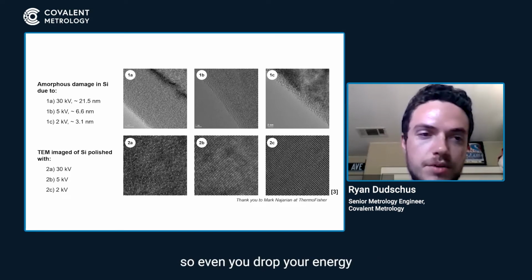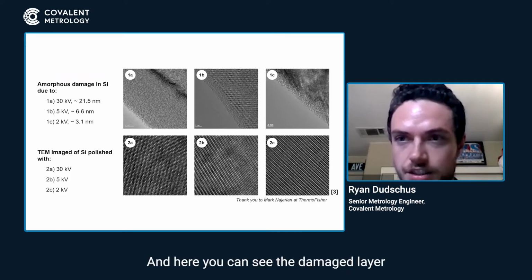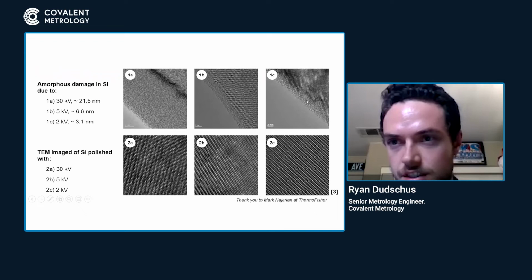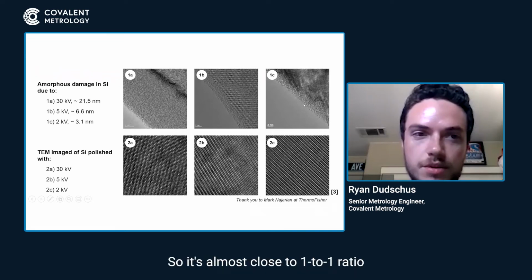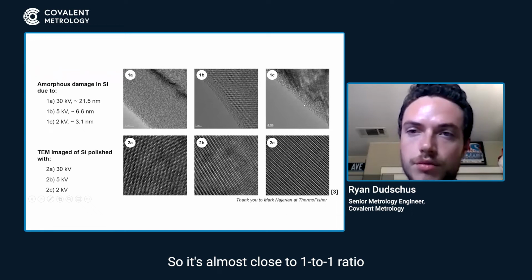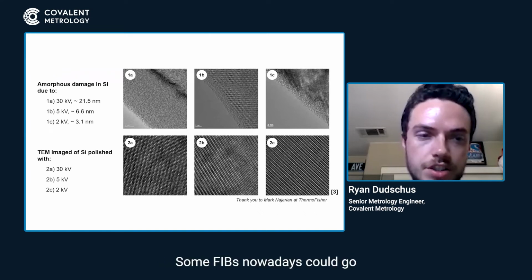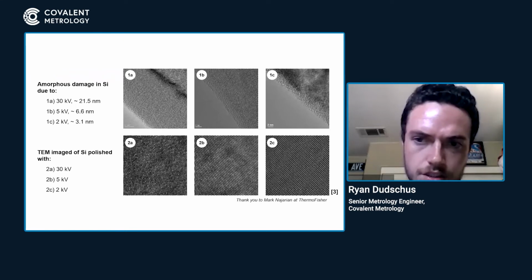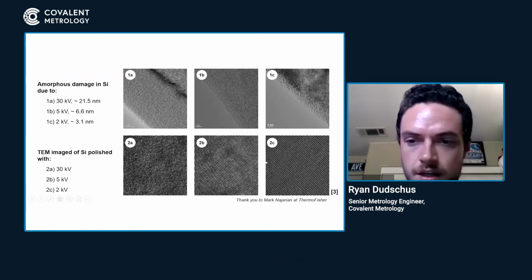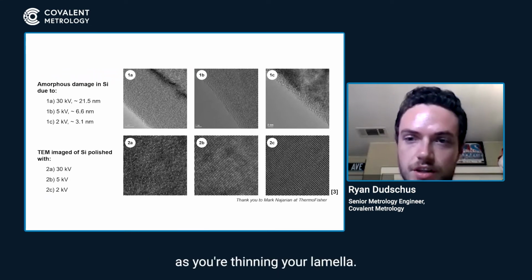So you drop your energy even lower to 2 kV. And here you can see the damaged layer is this fuzzy layer right here. It's about 3 nanometers thick and so on. So it's almost close to a 1-to-1 ratio of damaged layer to whatever FIB energy you're using. Some FIBs nowadays can go as low as a few hundred volts, so you get even better image quality. So this is a very important thing to keep in mind as you're thinning your lamella.